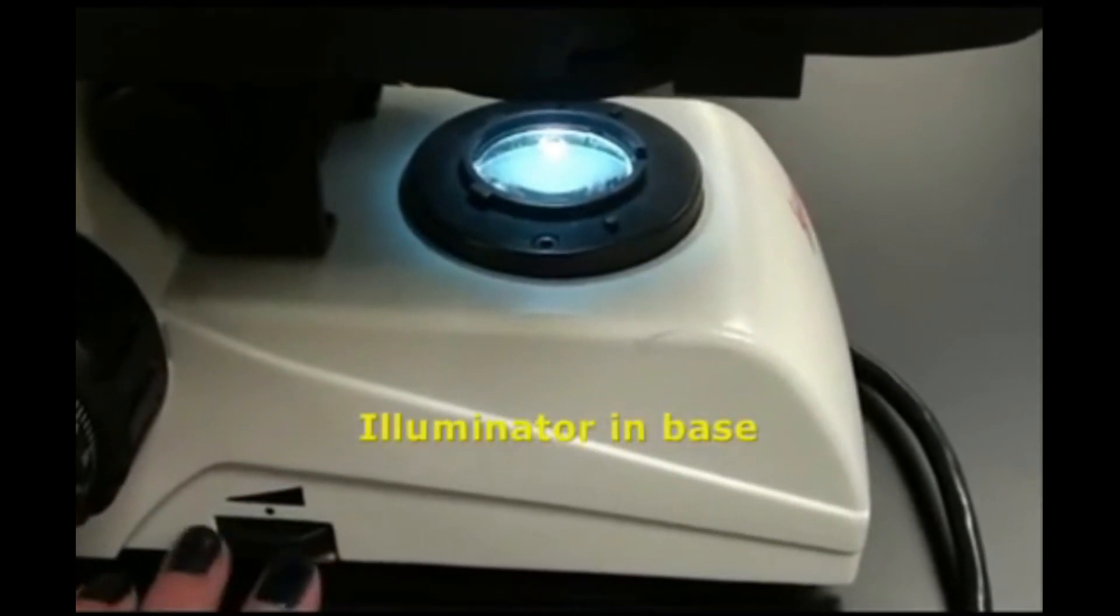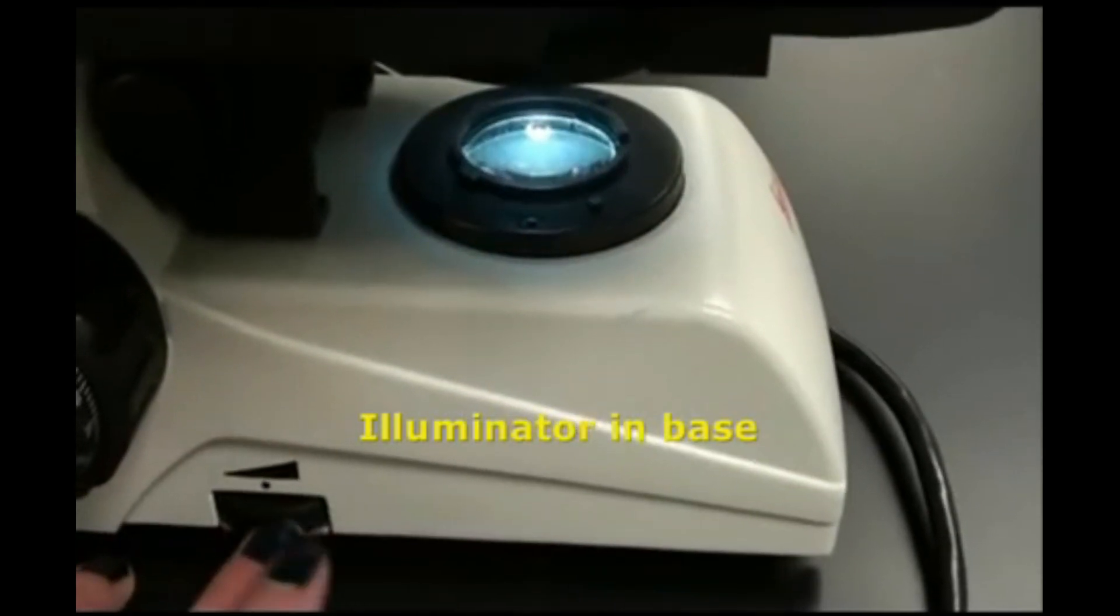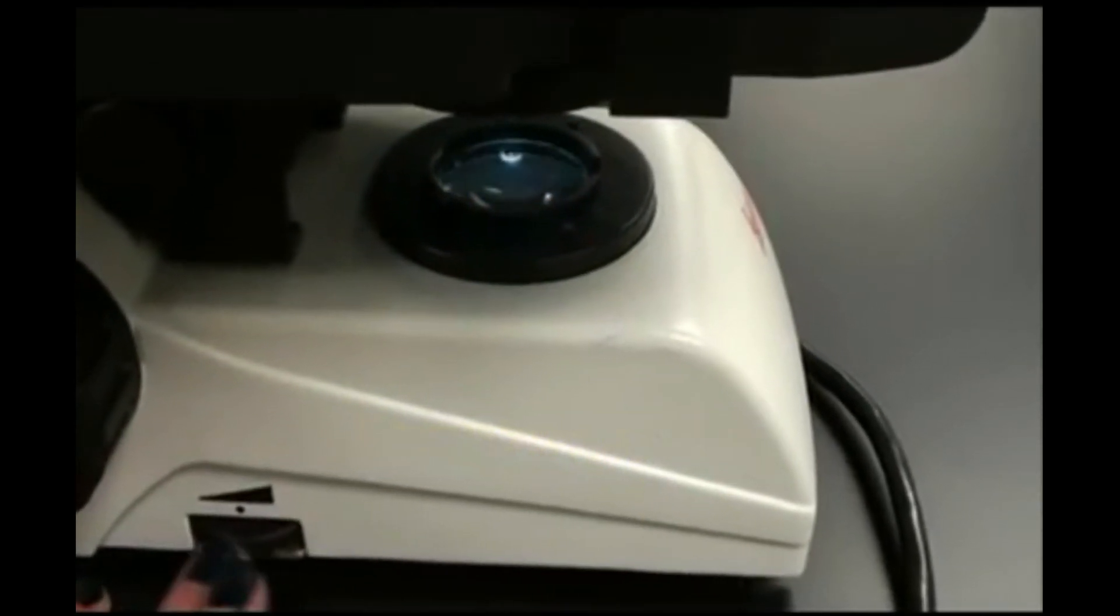Most compound light microscopes have a dial that will adjust the light level from the illuminator in the base.